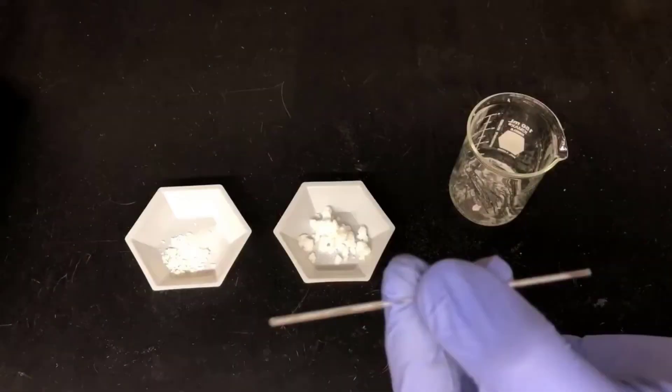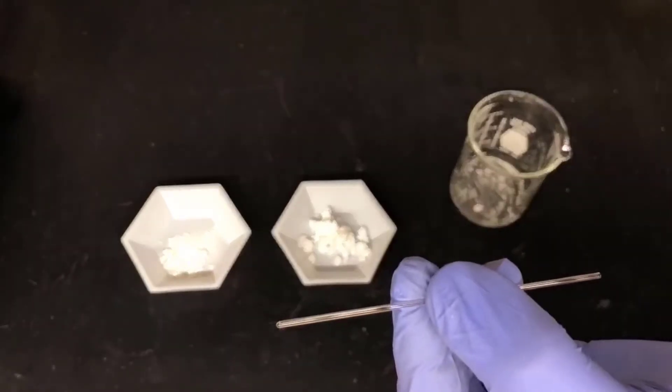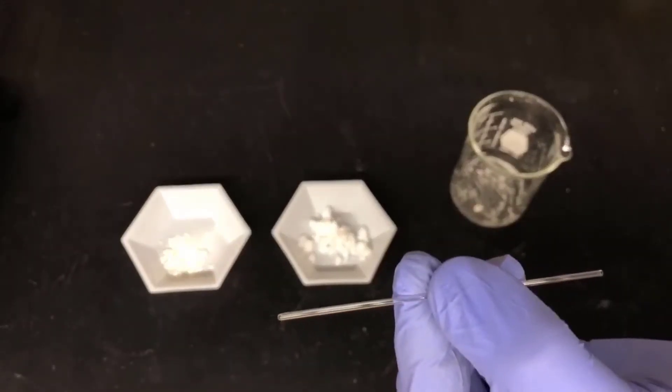Here I have the three solids that were isolated in this experiment: the binder, aspirin, and caffeine. I'll be taking melting points of the aspirin and caffeine samples to characterize them. To do that, I'll be putting a sample of each in one of these microcapillary melting point tubes. This is a tube that's open at one end and closed at the other.